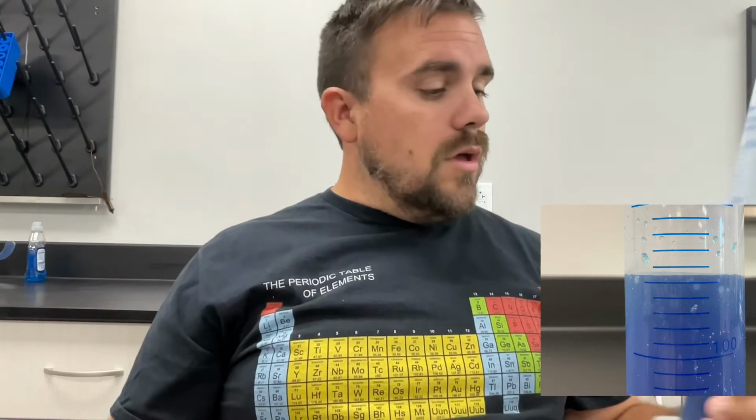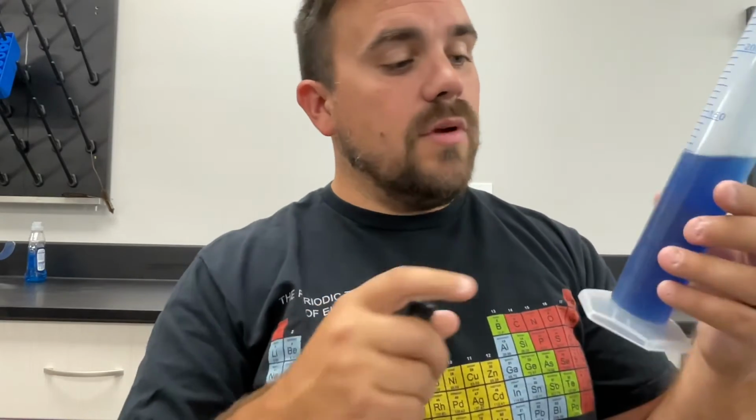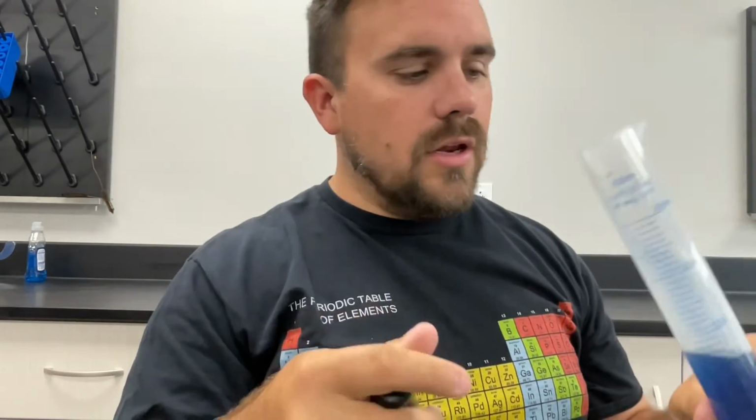And so right now you can read it on your own, but to me I'd call that about 150. No, excuse me, 127, maybe 127. And so then if I drop this in, one thing real quick, this is water, it just has food coloring in it.